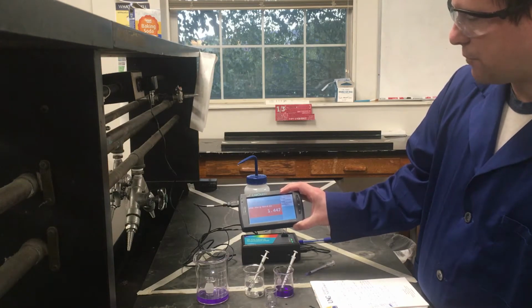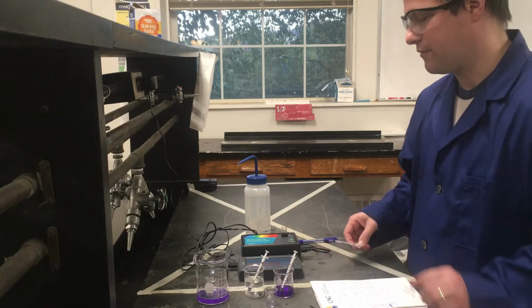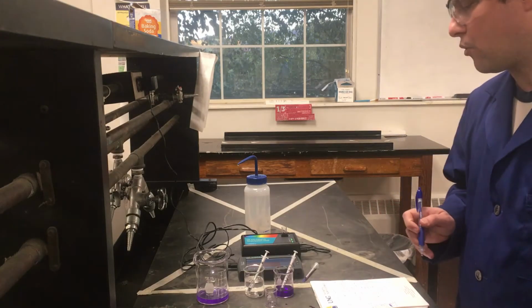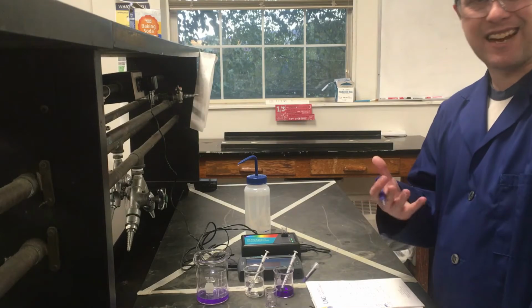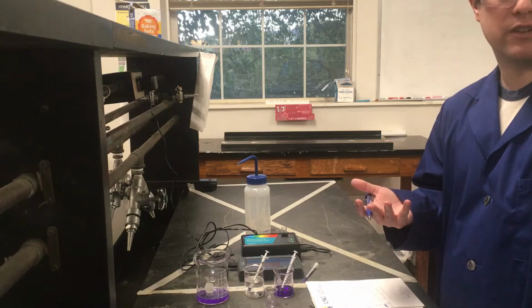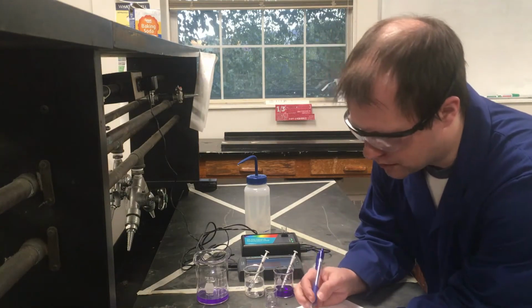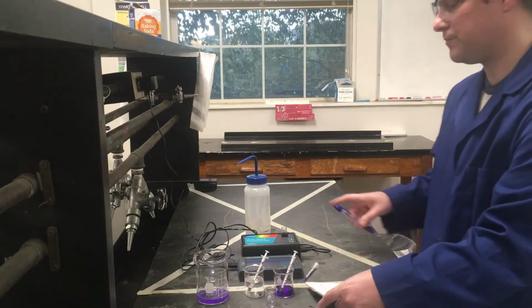It's bouncing around quite a bit, so I'm going to give it a second to stabilize. Now that it's getting a chance to slow down, it looks like it's settling in about 1.456 roughly. That last decimal, it's not the end of the world if we don't get it perfectly accurate. It's our estimation in terms of sig figs and things like that anyway. So not really that big of a deal if it continues to bounce around. So I'm going to write this down as 1.456 for my absorbance.